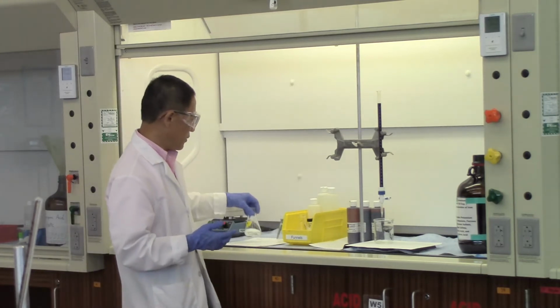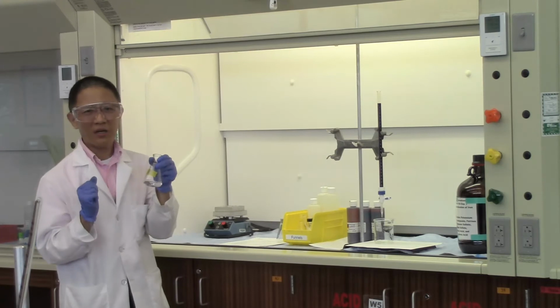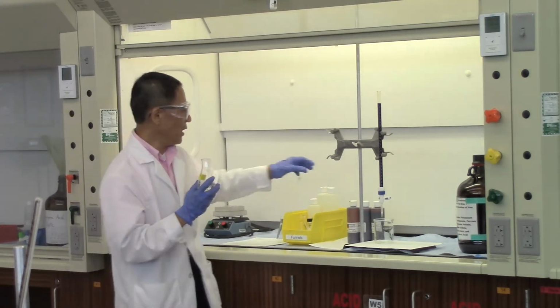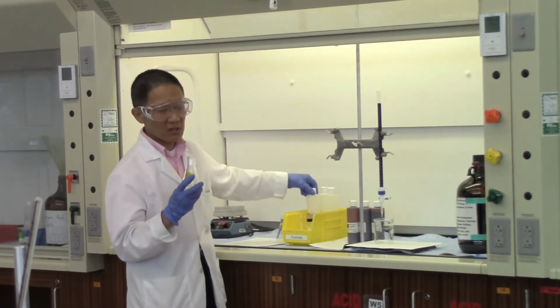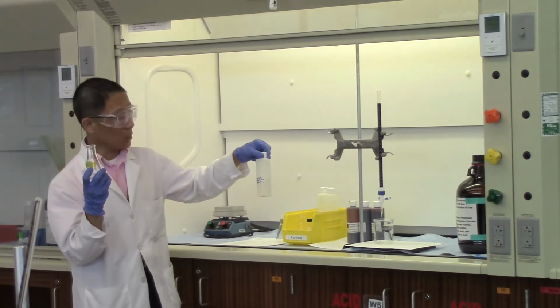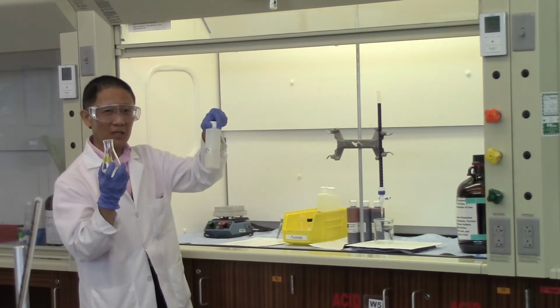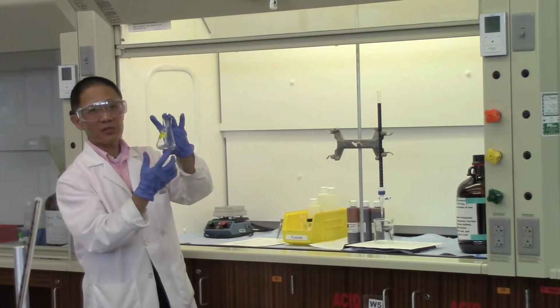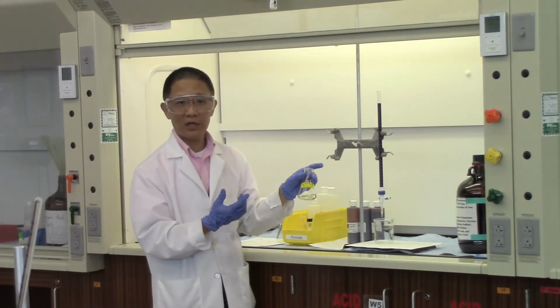Once you have the sample there, we want you to dissolve the sample in approximately 25 milliliters of 1 molar sulfuric acid. So we have the 1 molar sulfuric acid solution, and then just to improve the solubility and acidify the solution further, we want you to put 4 to 5 drops of phosphoric acid into the solution. So now I have all the samples dissolved with the acidic solution, and we're ready to do the titration.